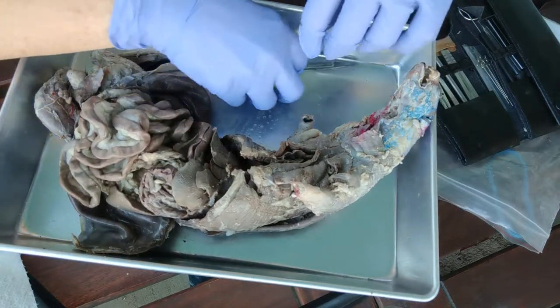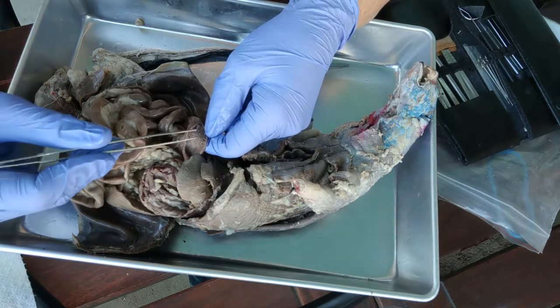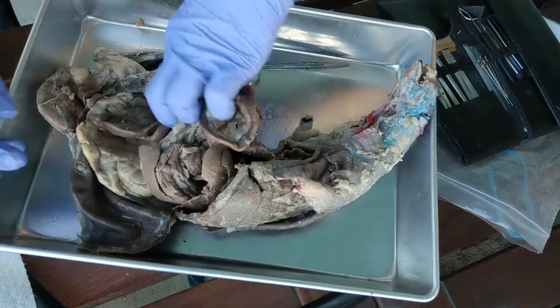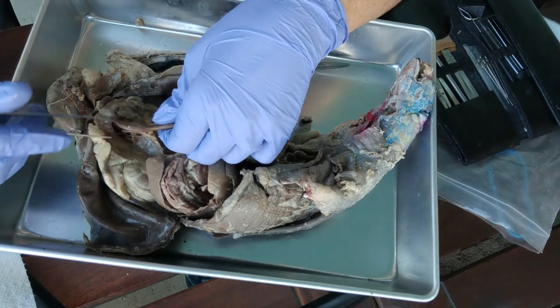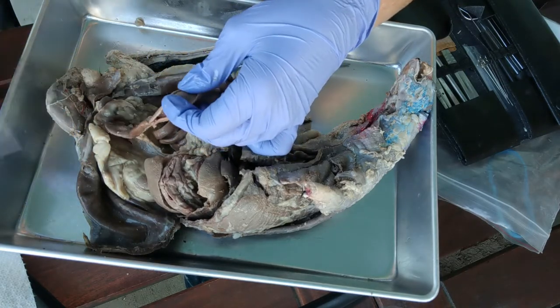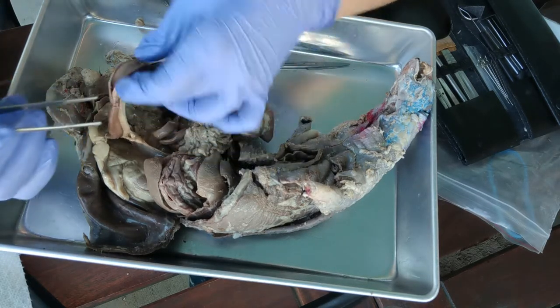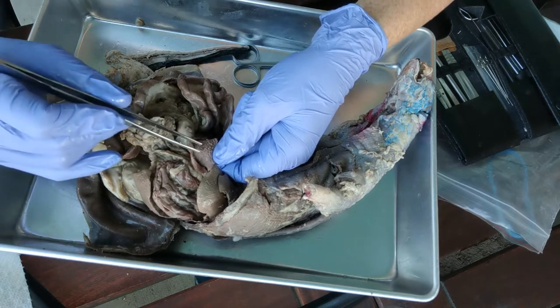Now let's compare the texture inside the duodenum to that inside the large intestine. The duodenum is really fluffy because of the villi — those finger-like extensions. If we cut open into the large intestine, down here is the rectum and this is the colon. Looking inside the colon, there is still some texture in the mucosa with intestinal crypts, but it's not the same elaborate texture as the duodenum. We do not have those villi here.